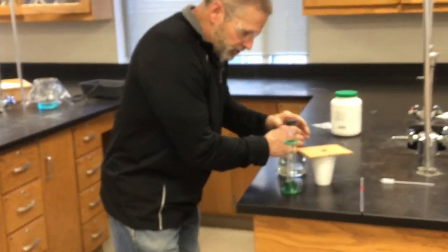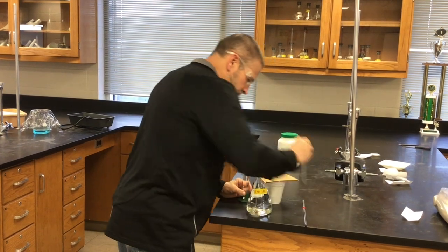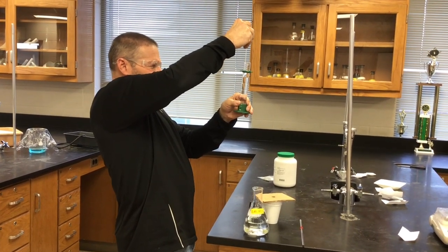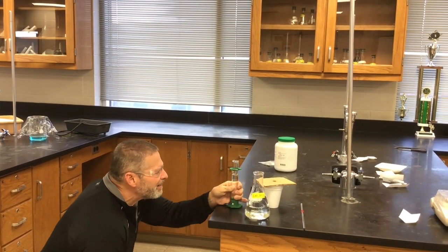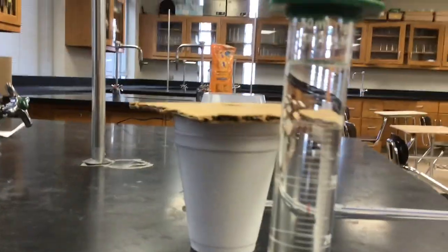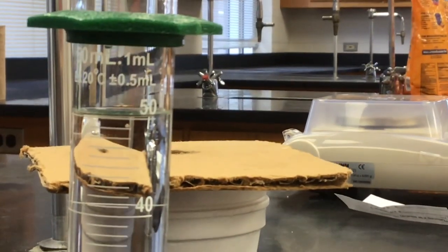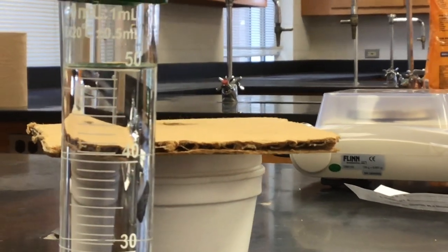So, I'm going to measure out the HCl first. 50 milliliters worth. Let's try to get as close as we can. I think that's pretty close. A little bit of a disadvantage with the glasses. We'll take that. How about that meniscus right on the line? What are you going to call that, though? How many sig figs does that graduated cylinder give you? I'll leave that to you. Graduated the whole milliliter.